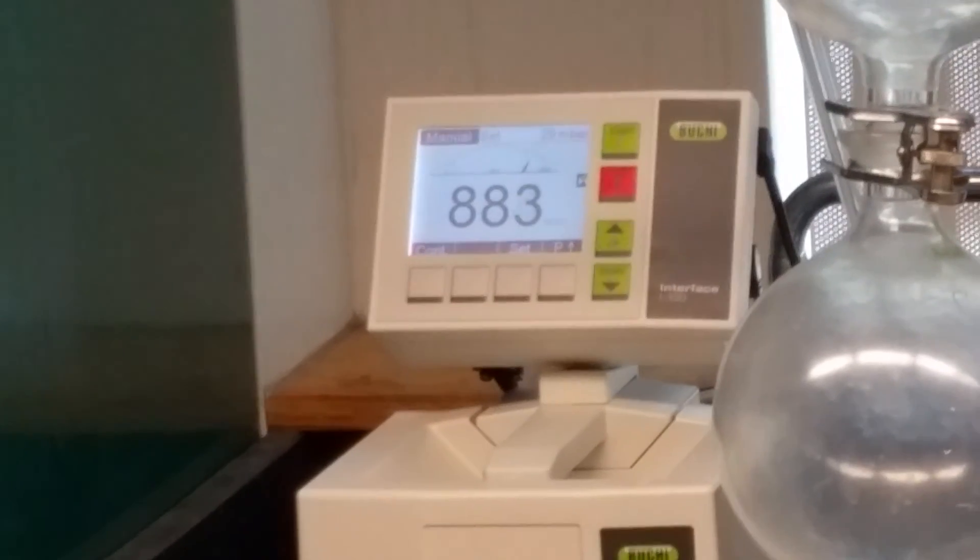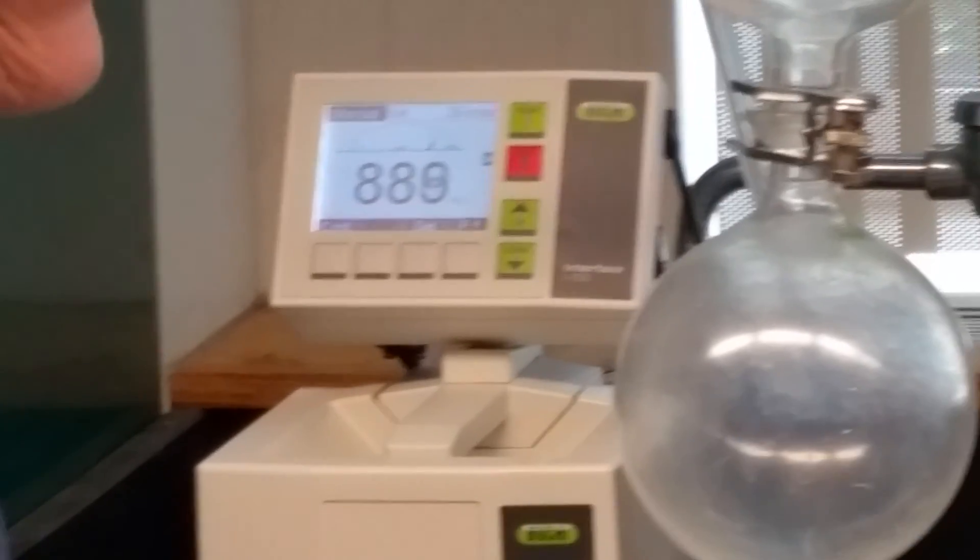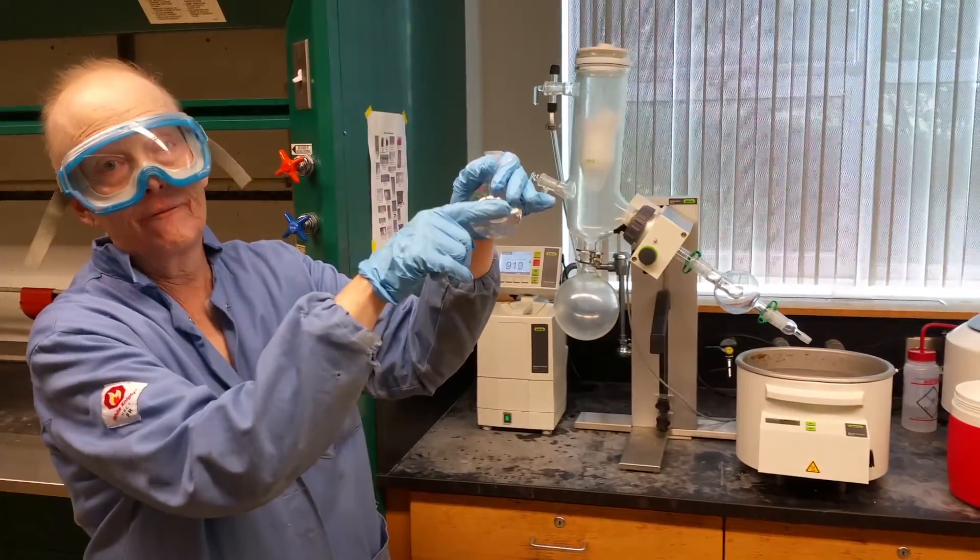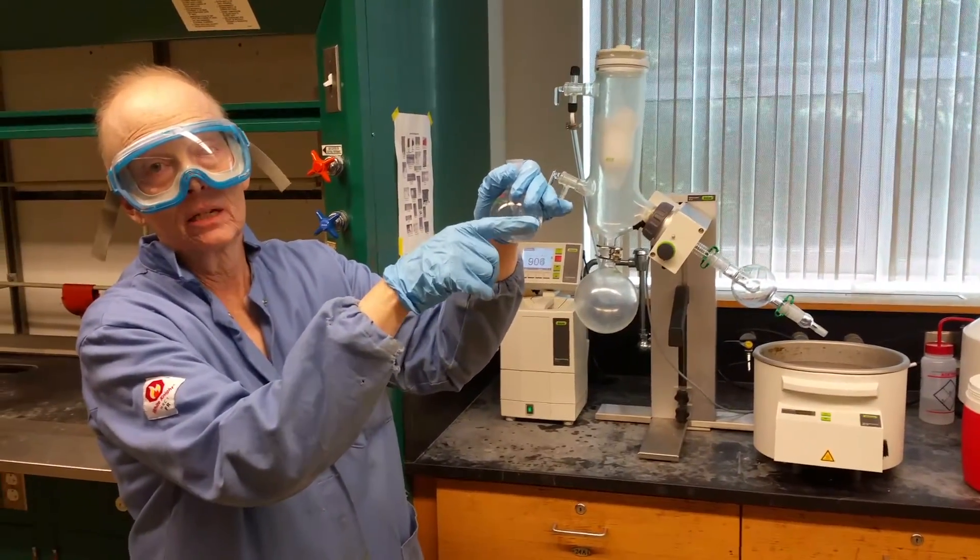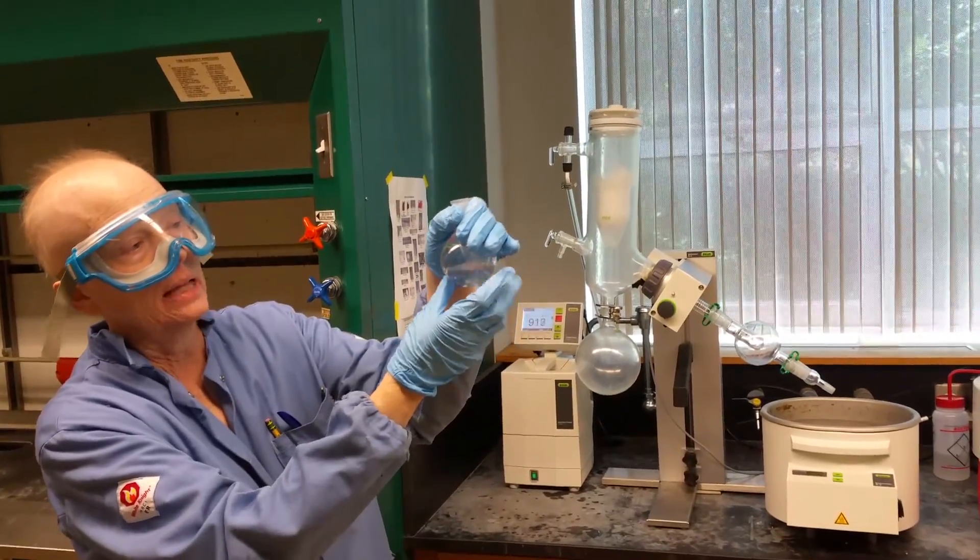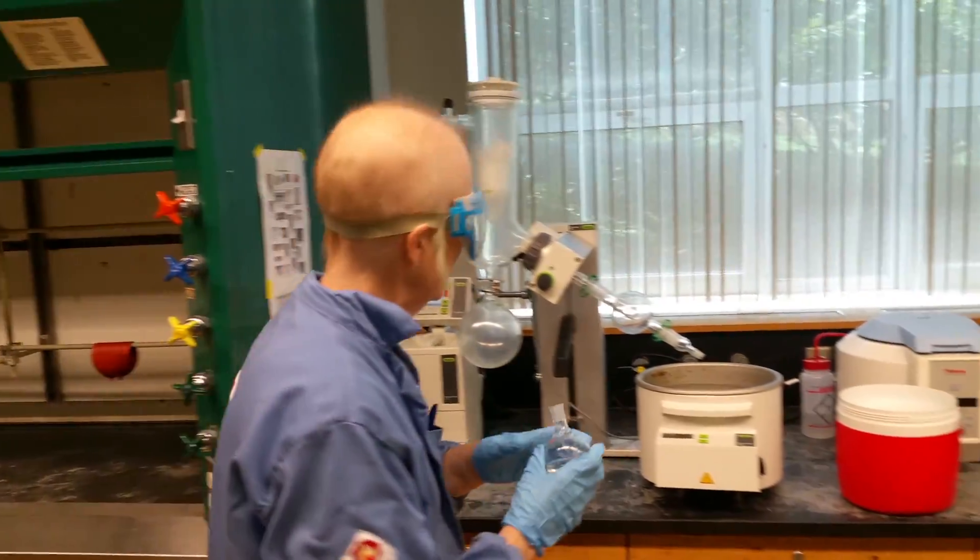What's happening here? The pressure is going down. So what am I going to do? I'm going to take my sample. And by the way, when we're talking about rotary evaporation, full is half full. You never want this more than half full. I'm a little bit less than half full. This has an organic solid dissolved in some acetone. It's just for demonstration purposes.